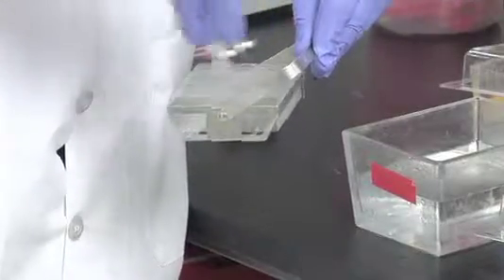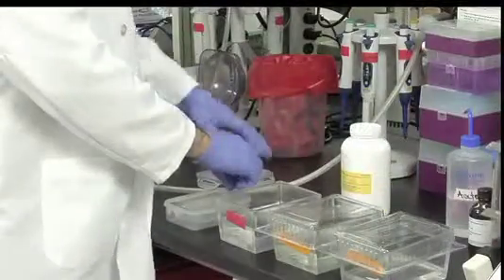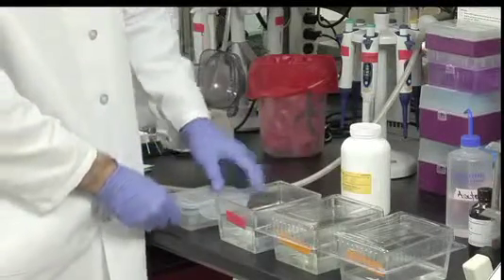Slides at the end of the metal rack are often of a lesser quality and discarded prior to use. Once the slides are dried, they can be stored in a sealable container with a silica packet to maintain a dry atmosphere for up to several months at room temperature before printing the arrays.